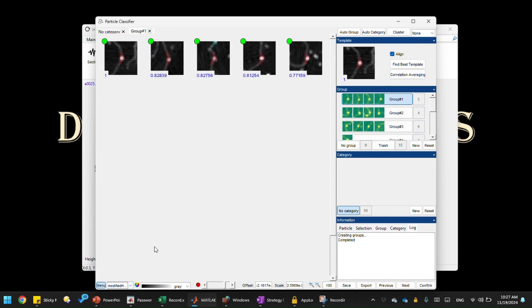That's what's happening in the back end. But this is useful for our DNA alignment, and it looks pretty good. You can see this is a bent state. I resolved this bent angle species. Let's turn to the next group. This one is more like a 90-degree bend. This one actually is a false positive. But overall, I think it does a pretty good job. If it's a false positive, this is essentially an unbent state, 0 degrees. So we can just throw that into a new group.